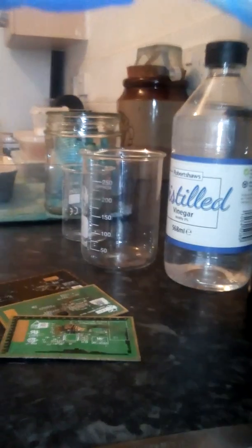I've got three here, using the usual mixture — 12% peroxide, 5% acetic acid. If you can get stronger vinegar, go for it.